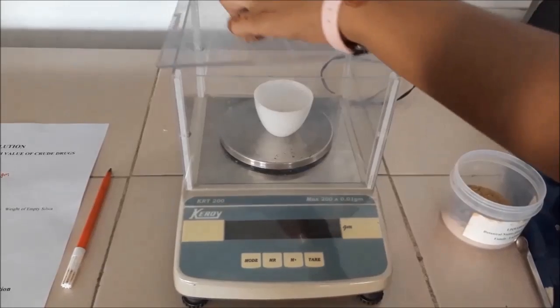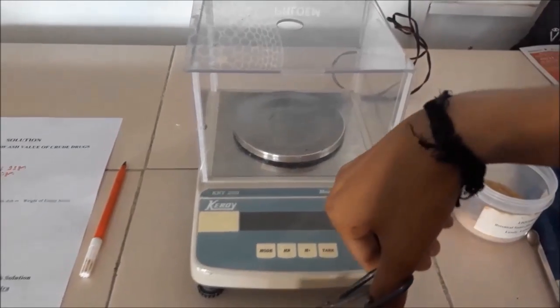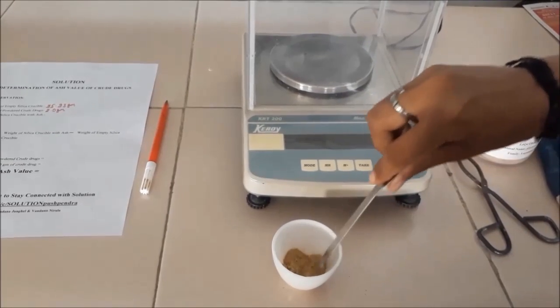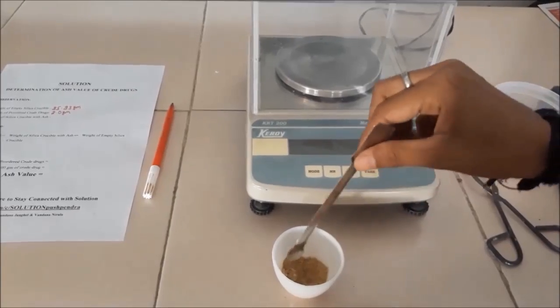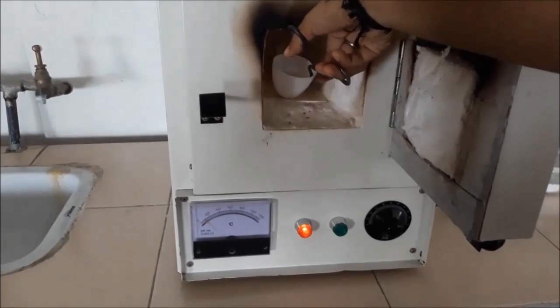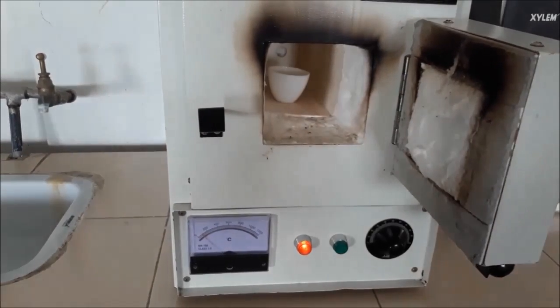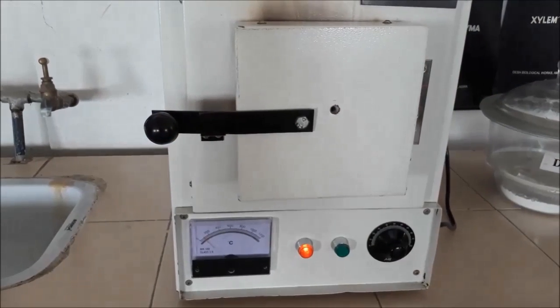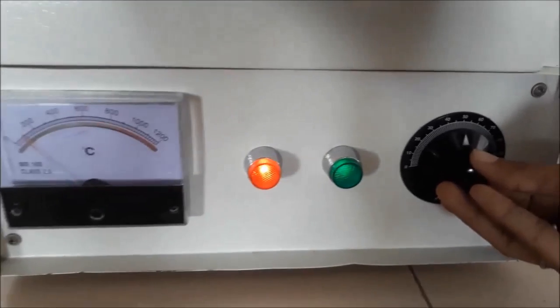After weighing 2 grams of powdered drug, record it in the record sheet as the weight of powdered crude drug. Then switch off the digital balance. Take out the silica crucible containing the crude drug with the help of tongs. Spread the powder in an even layer with the help of a spatula, then place it in the muffle furnace.